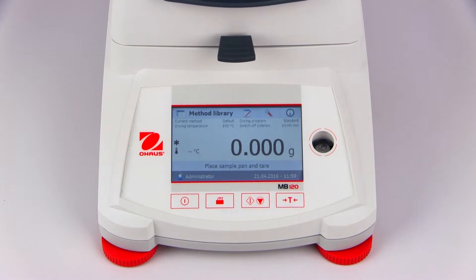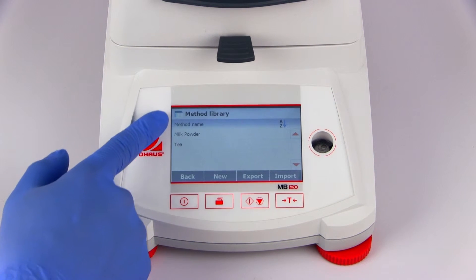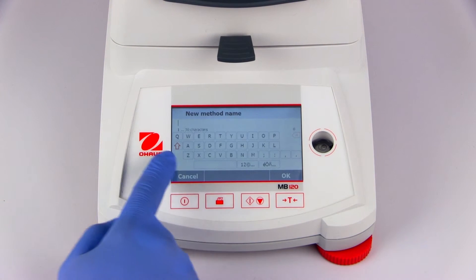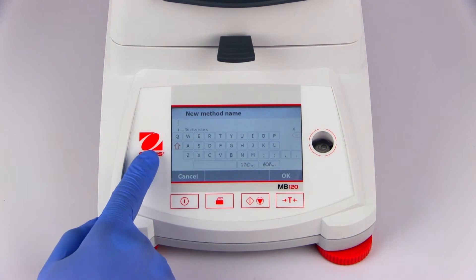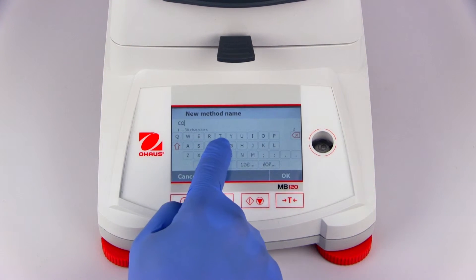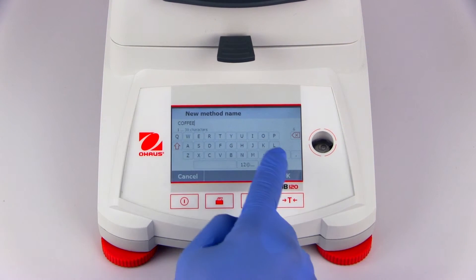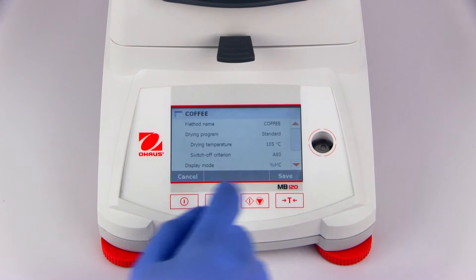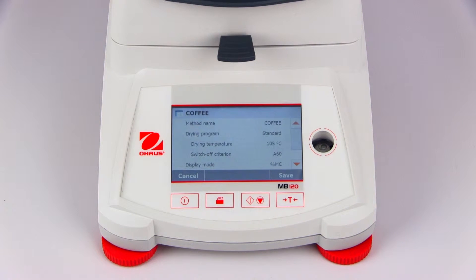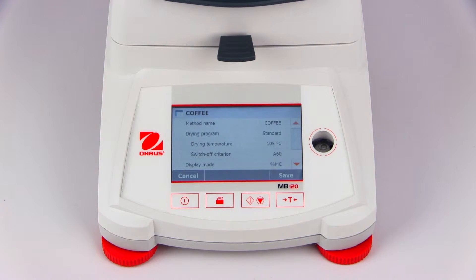A new method can be created by entering the method library, where a list of existing methods is shown, and selecting New. You'll be asked to enter a unique name for the new method. Once a name has been entered, a list of method parameters will be shown that can be modified to best fit the sample under test.